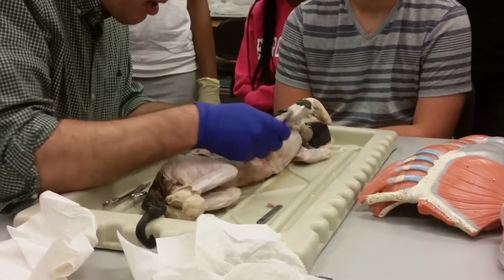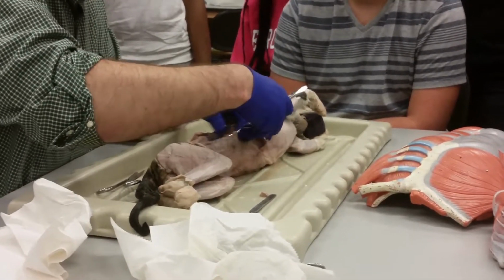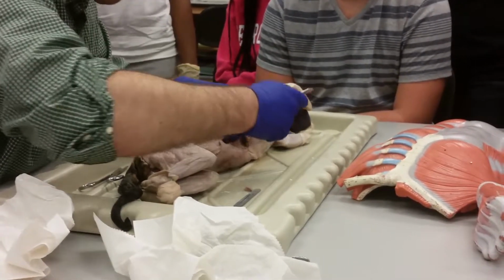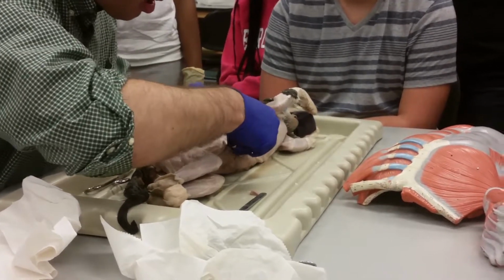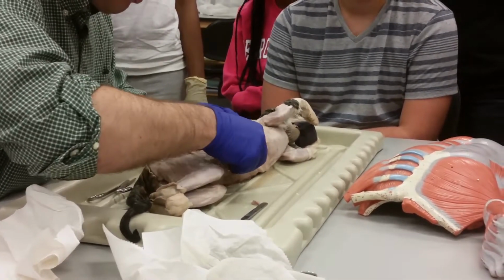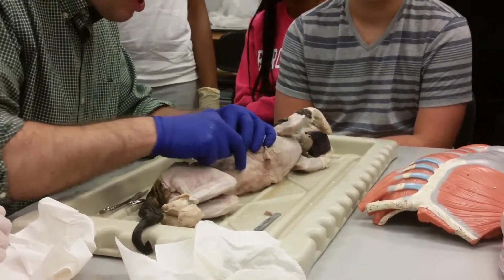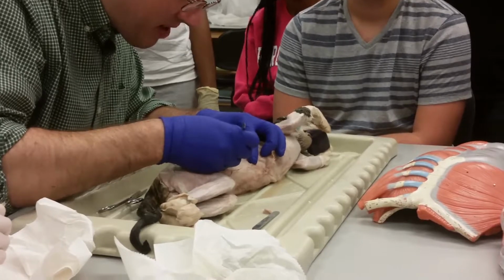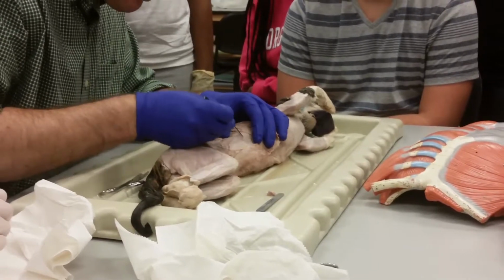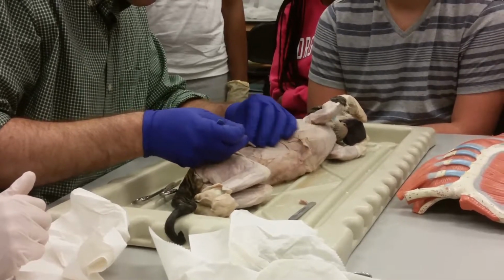But if I try and peel some of that fascia away, just a little bit, sometimes I'm able to actually separate the internal oblique. Okay, you can actually see there's two different sets of fibers there. There's the internal oblique fibers, and there's the transversus abdominis fibers. Those are two different layers of muscle. I know they look similar, but they're not.